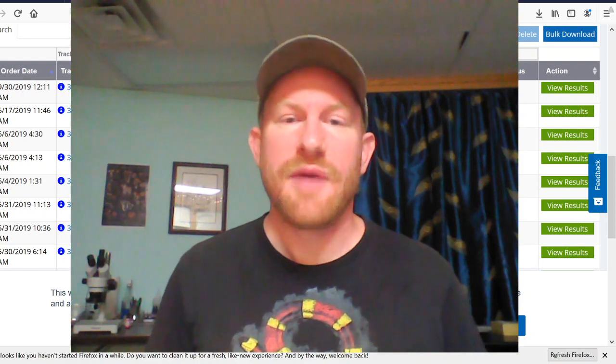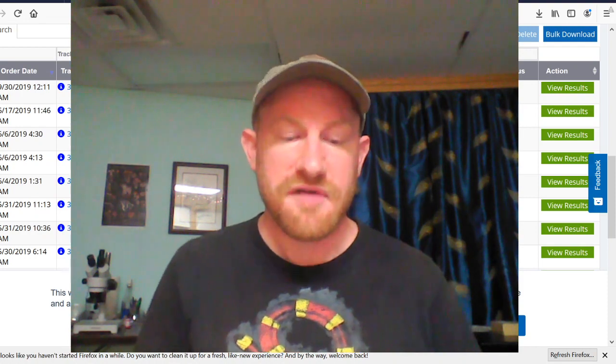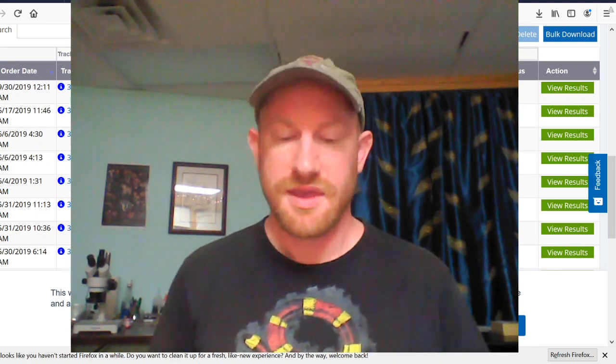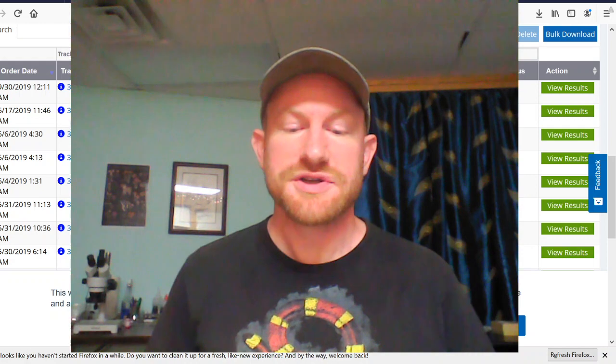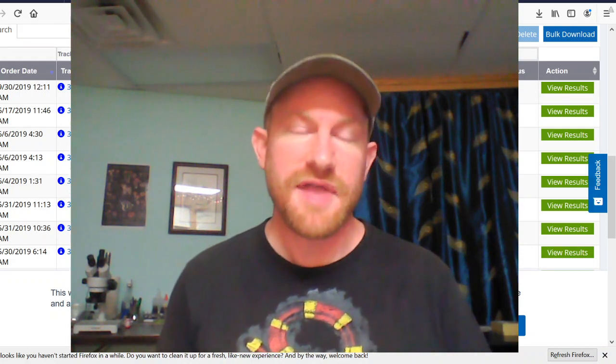Hello, I'm Alan Rockefeller, and I do a lot of sequencing of mushrooms that I find in California and Mexico. And today I'm going to show you how to edit these trace files and turn them into useful data.